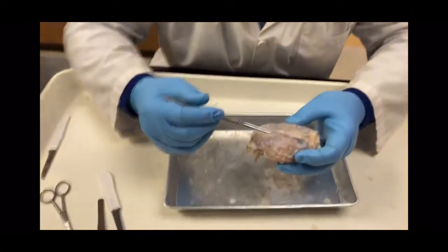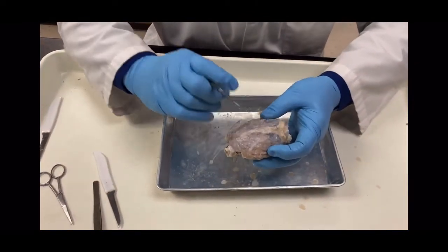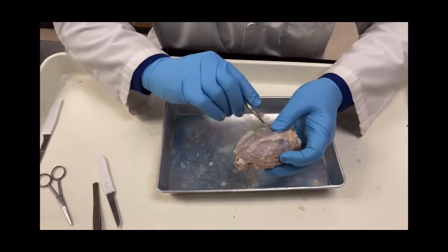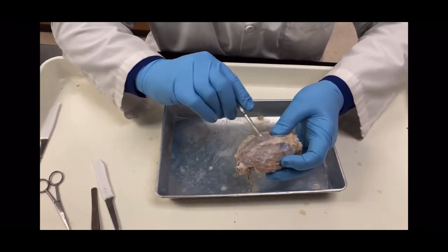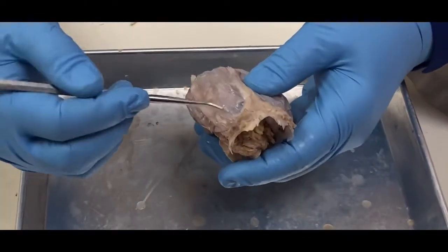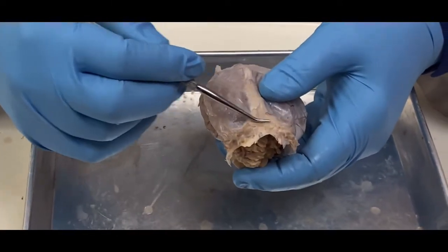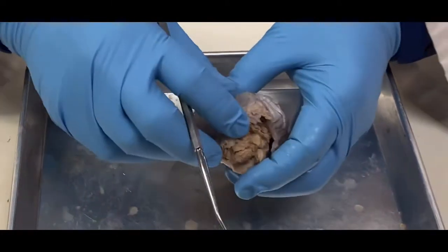And the first thing we're going to do is take a look at the meninges. So these are the meninges right here. You'll notice the meninges are not that thick. And if you notice right here, this is going to go into the longitudinal fissure, and this is known as the falx cerebri, right there. And then back here, between the cerebrum and the cerebellum, I actually have the tentorium cerebelli, which is going to be this part right here that's going to stick in there.